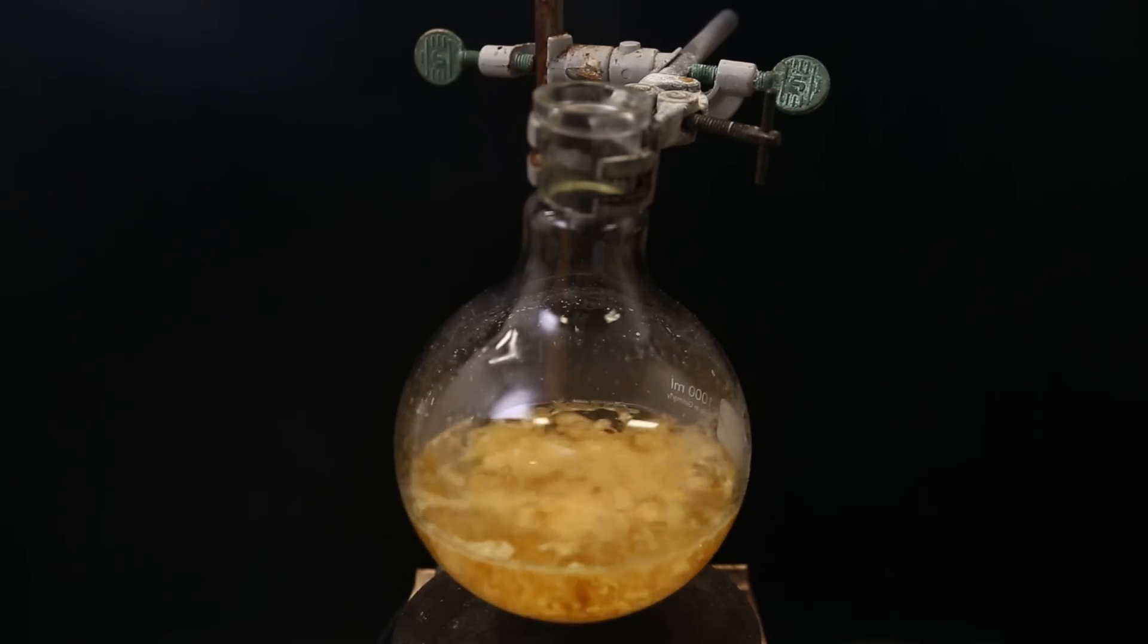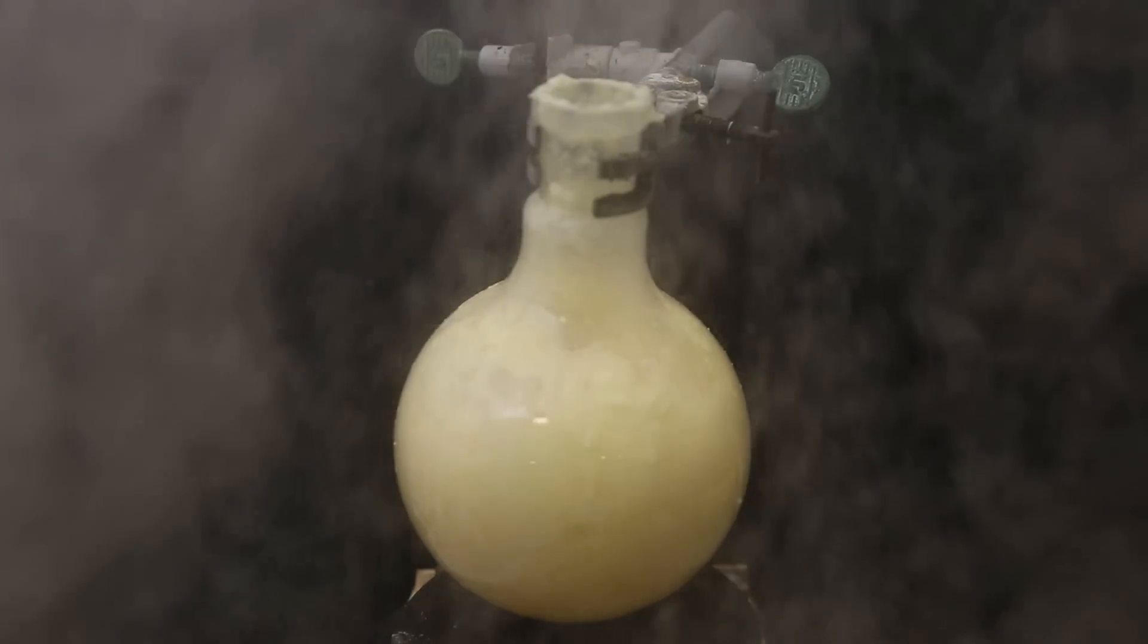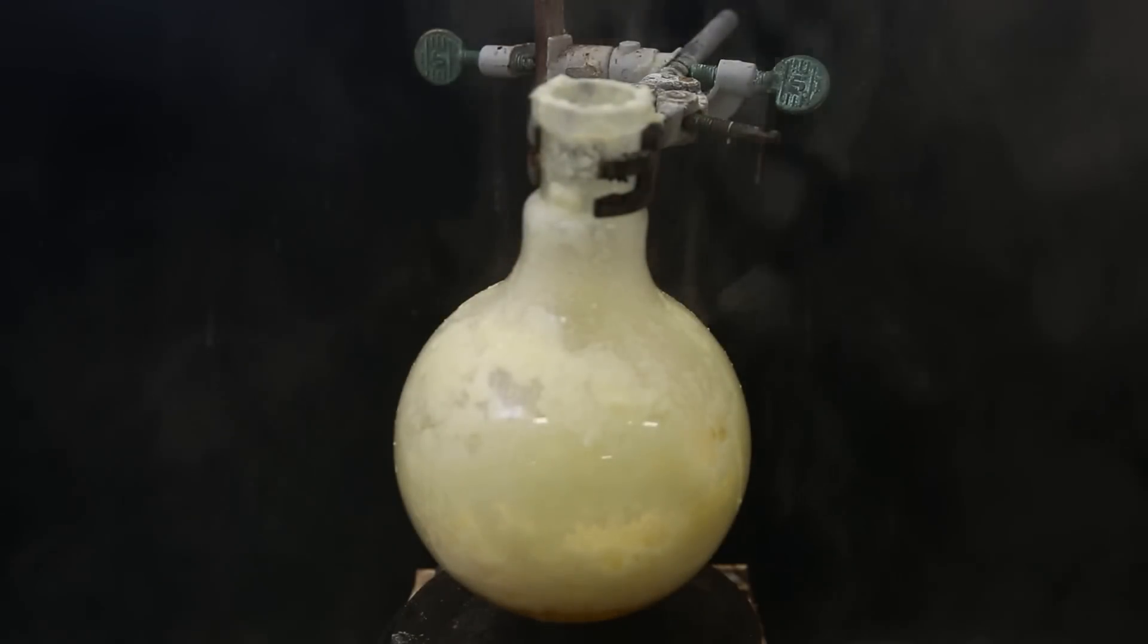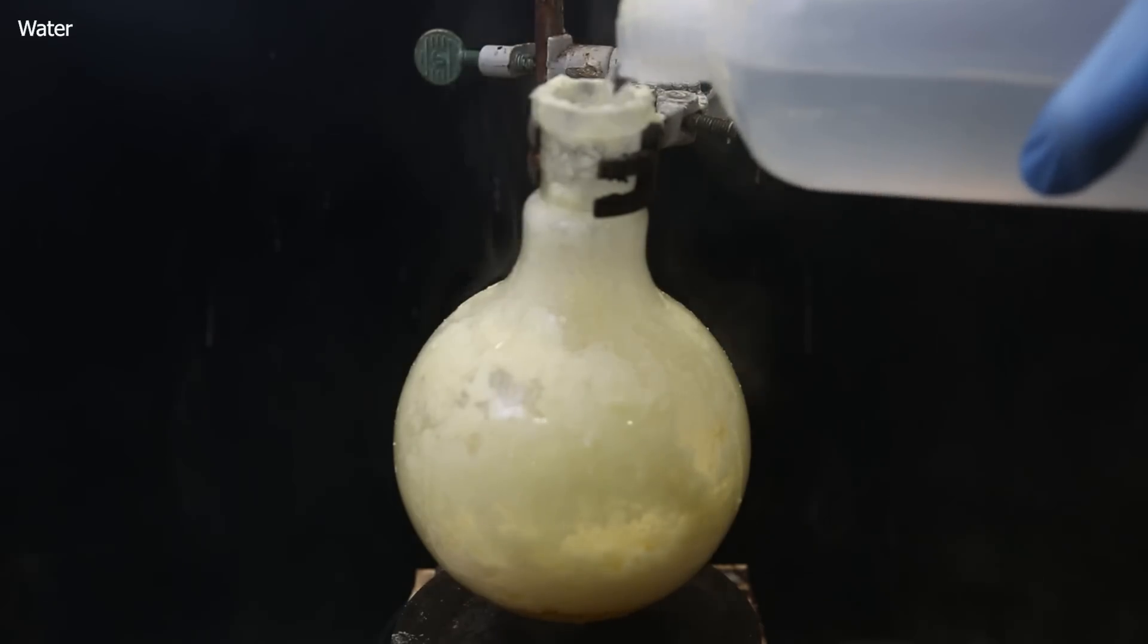What happened next, though, is not what I expected. [Explosion] So it is better to pour it slowly into a large amount of water with ice to controllably quench it.